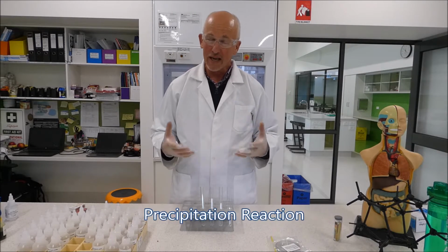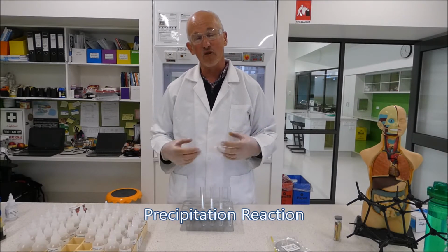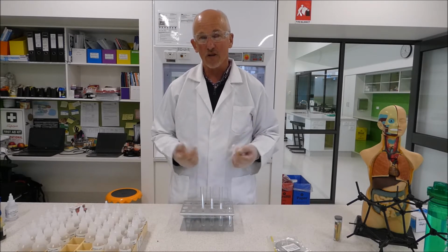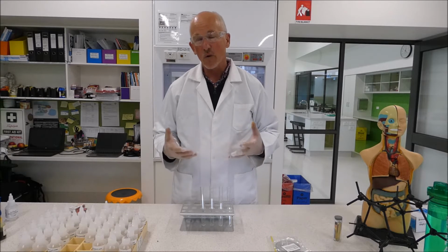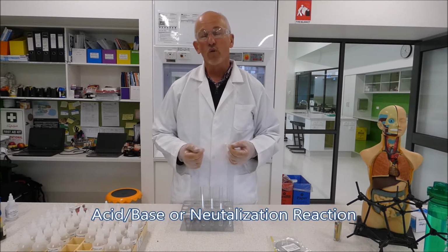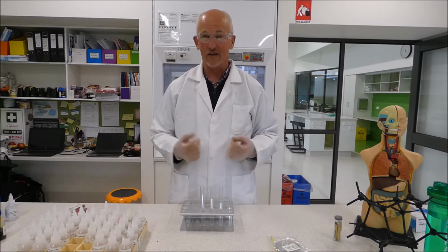Then we're going to look at a precipitation reaction. Precipitation reactions are where you add 2 solutions together and they form a solid. And we're going to make some observations about how we know a solid's being formed. And the last one is an acid-base reaction or a neutralization reaction where you add an acid to a base and it actually forms water and a salt.